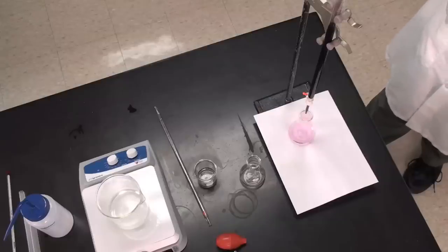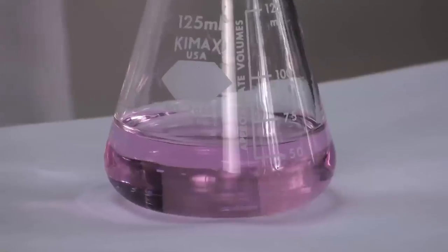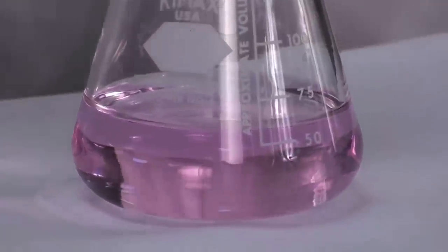You want it as pale as pink as possible. If you can get paler than what I've just gotten, more power to you—that's great. You want it as pale as possible. Any sign of color persistence means you've reached the endpoint of the titration.